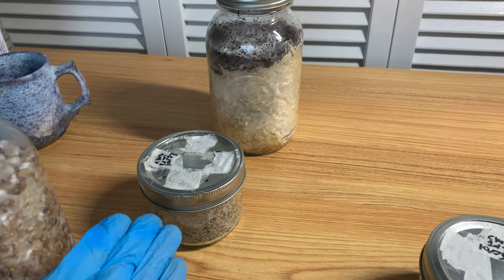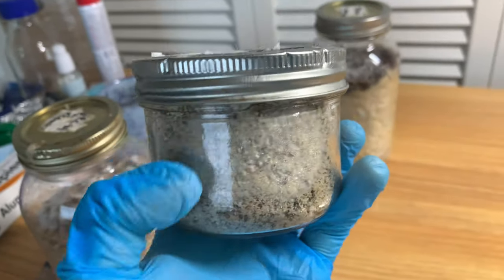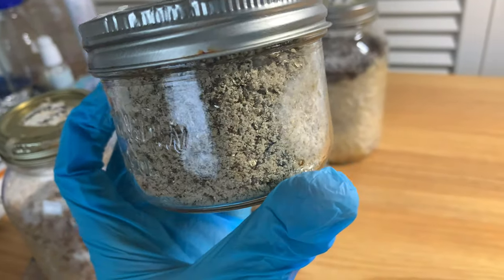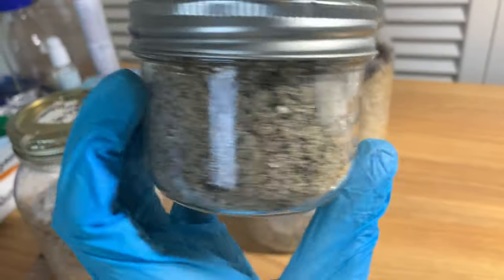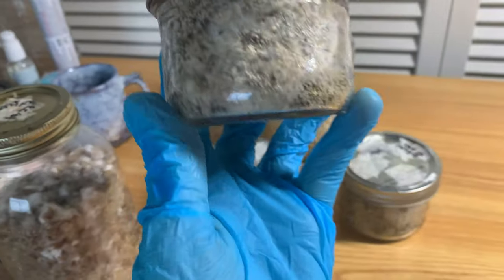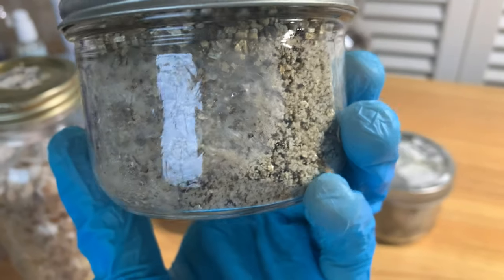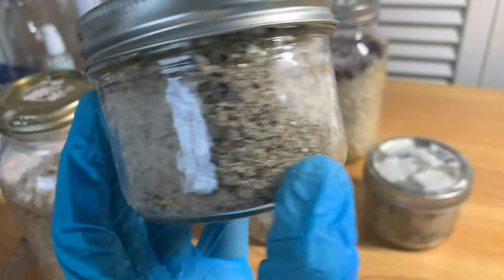You do have the benefit of having a cleaner culture. Here's a better one - see that? That's quite a bit. So I shot like two per hole on each side, then just one here, one here. And as you can see, some of them did inoculate. The one on this side did not, and the one on this side did not either. But it's good enough, and they are colonizing. It took many days - at least a week - for me to start seeing growth, which was surprising because the mycelium's already germinated. It's not like they need to germinate like a spore syringe. Technically it should have been faster.